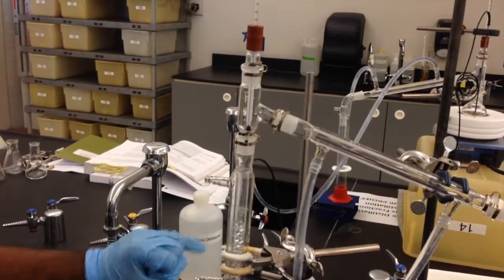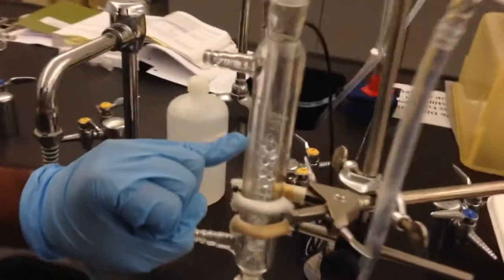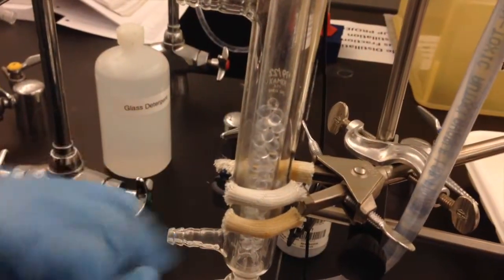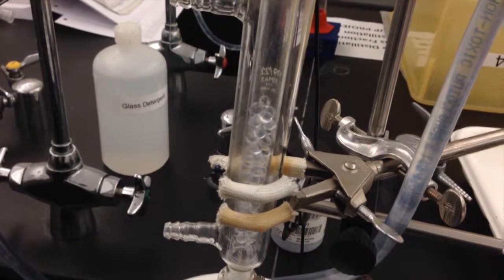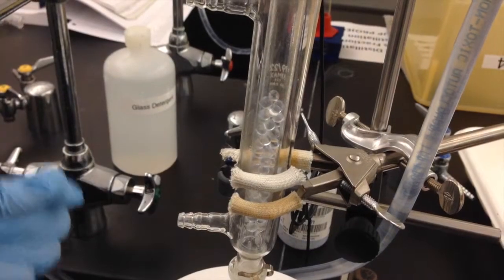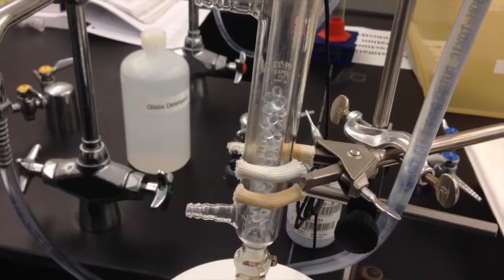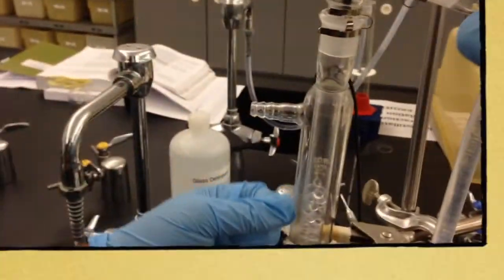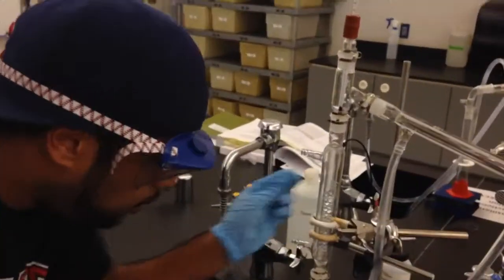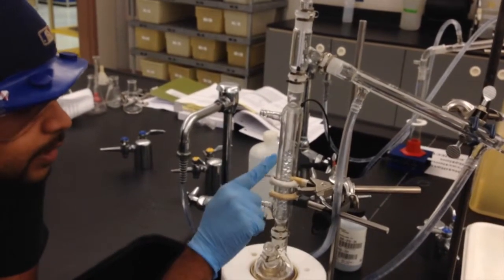Now, as you can see, the glass beads in here are starting to get a little bit moist. That's what you want. You don't want them drowning in this stuff. You just want them moist, because if they're drowning, you're distilling way too fast, and the concentration at the end is going to be altered, because you could have not just cyclohexane in it, but also molecules of toluene in there as well. Now, as you see this moistening up, what will happen is as the cyclohexane and toluene are evaporating through here, they will come through and hit these beads.